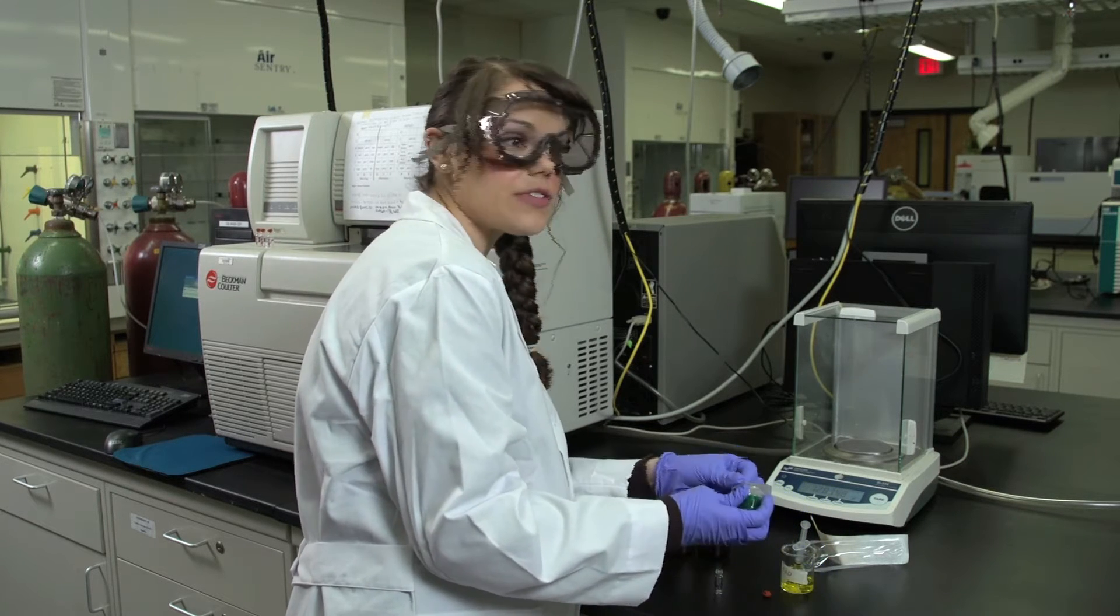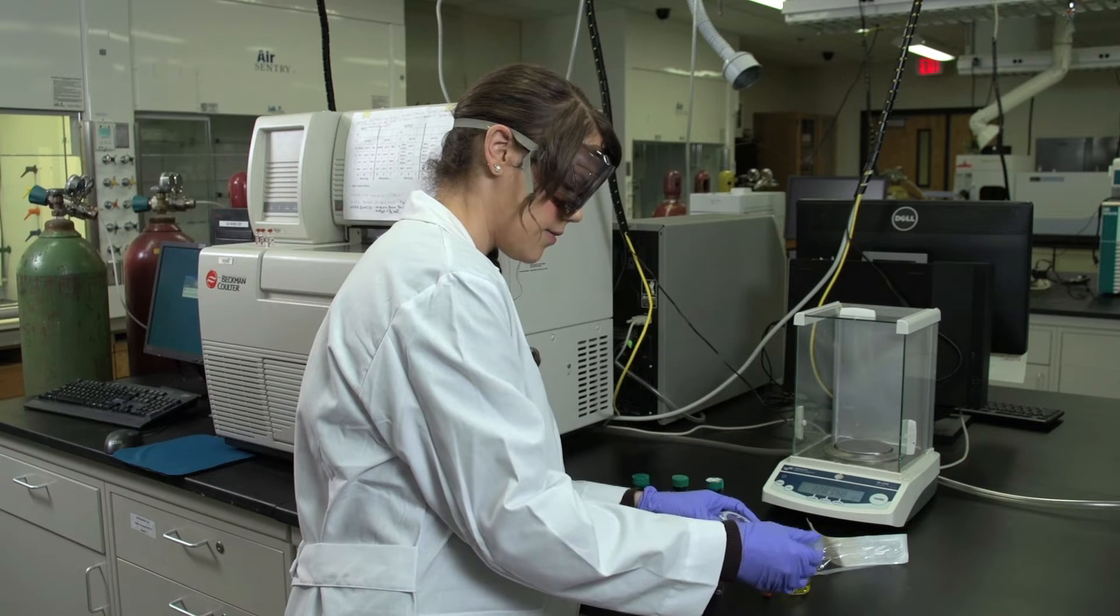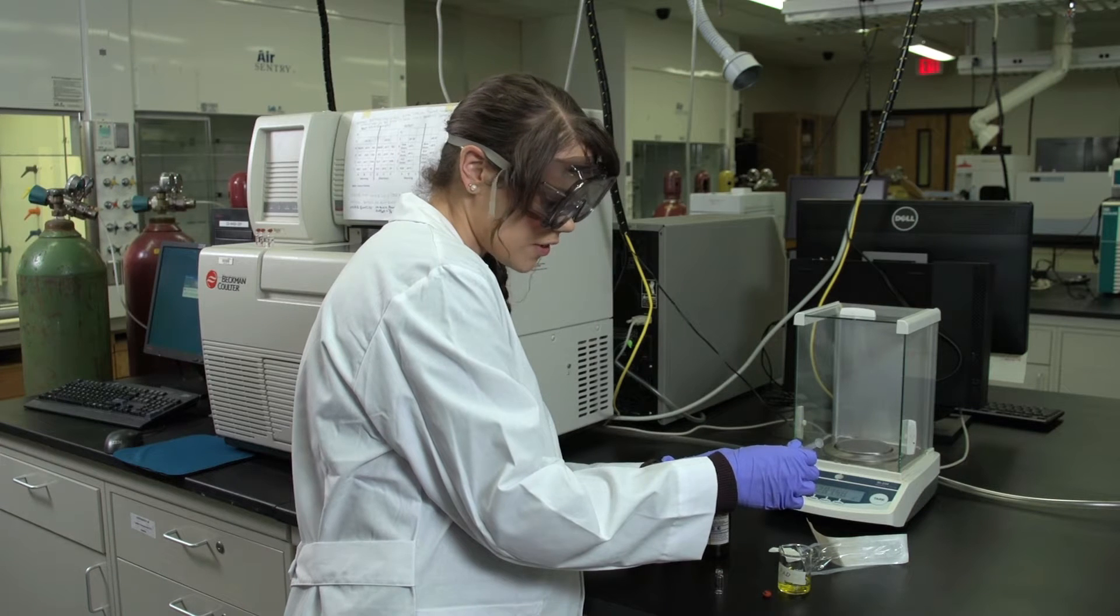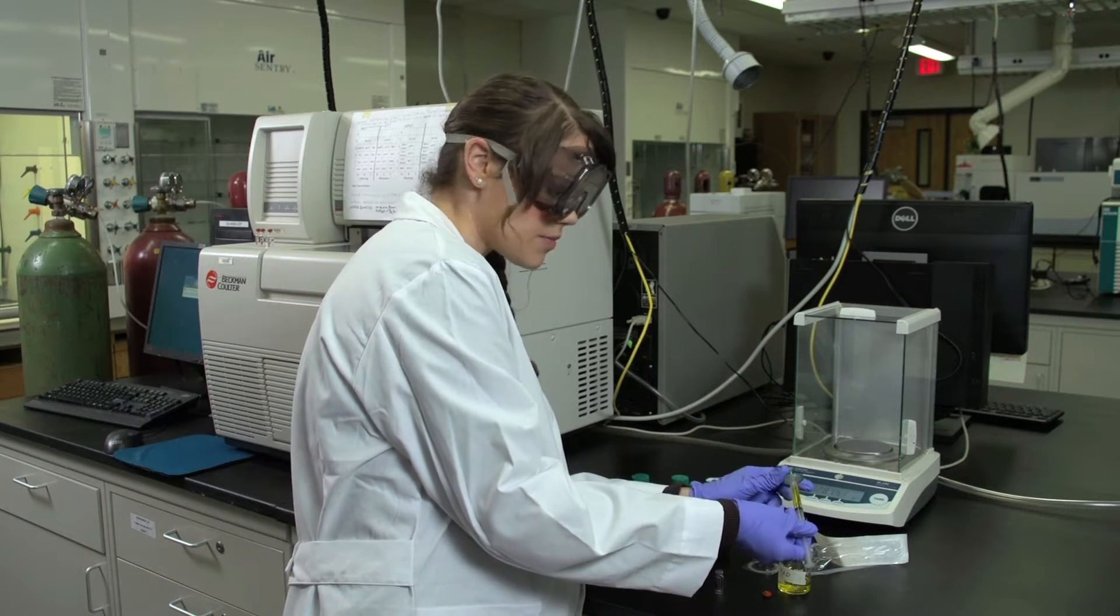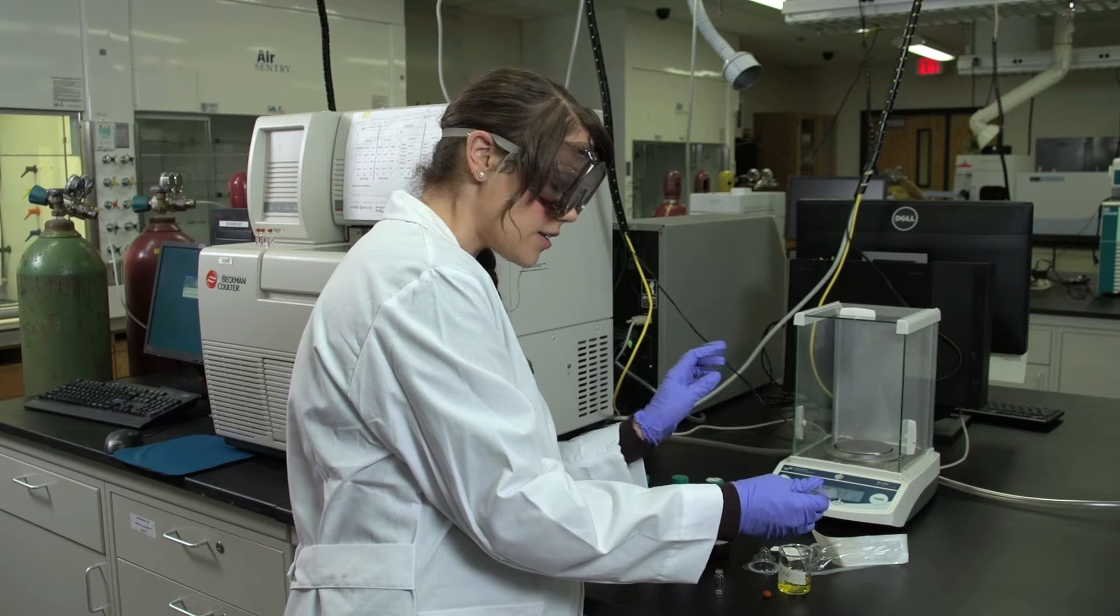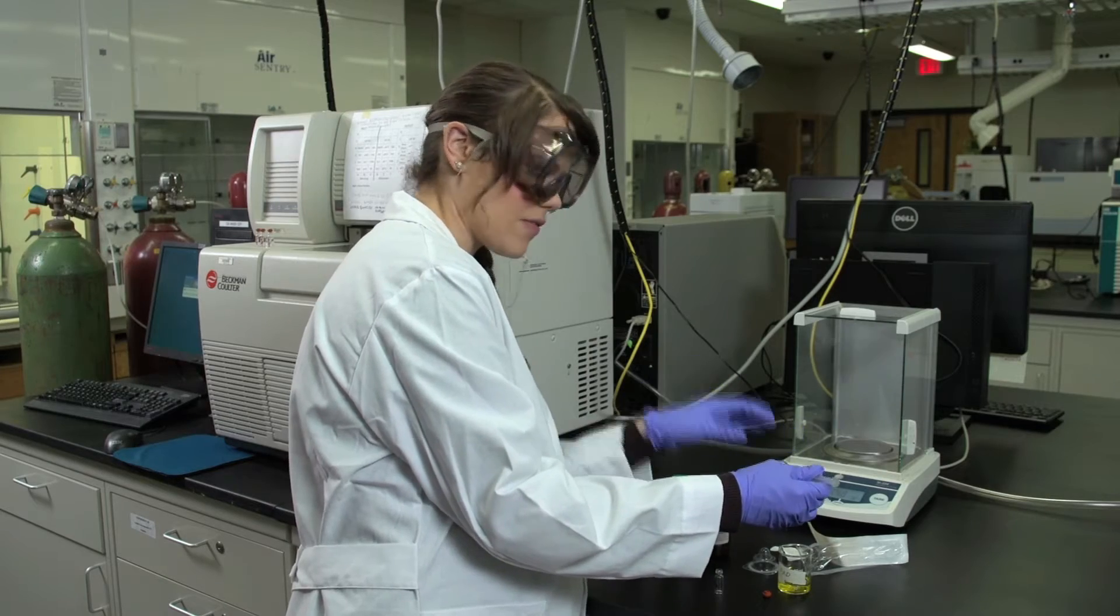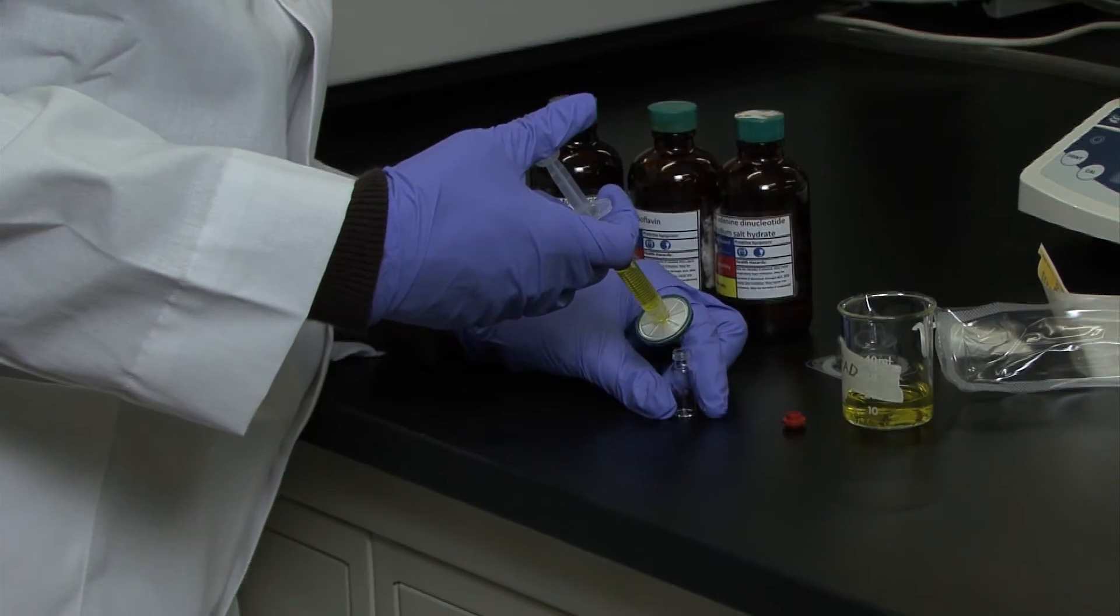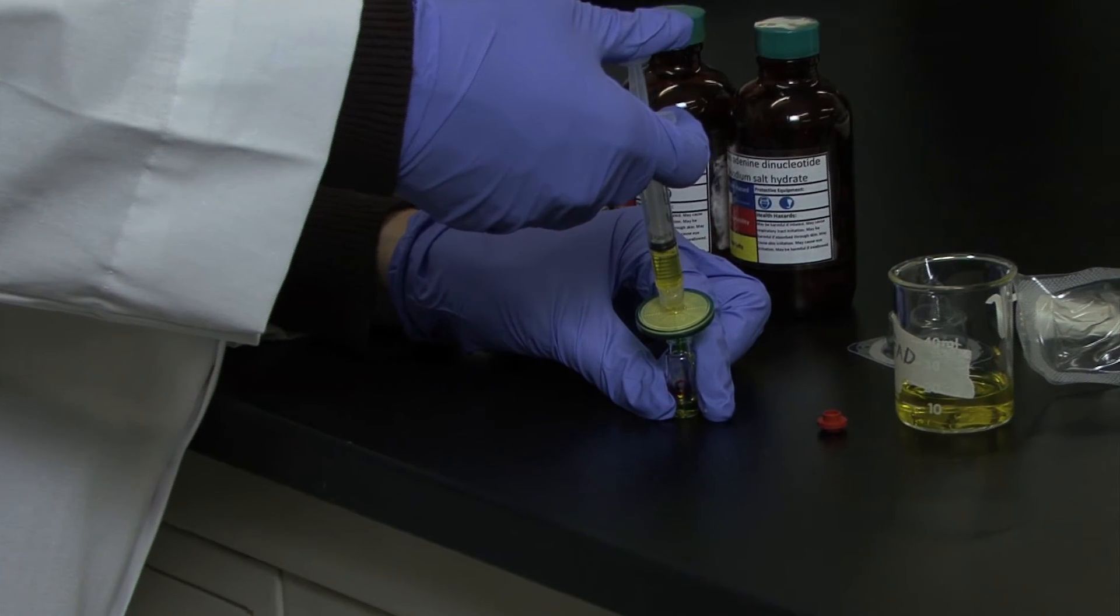Next, you need to attach your filter to the syringe. To do this, you're going to push the syringe into the filter and twist gently. I always double-check to make sure that the filter is attached to the syringe, because if it's not a tight seal, then when you push your solution through the syringe, it'll come out of the juncture and not be filtered. I'm just going to take the filter and set it on my vial, and gently push through to filter the solution.